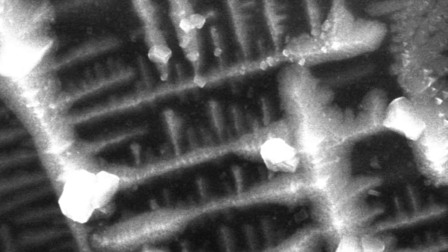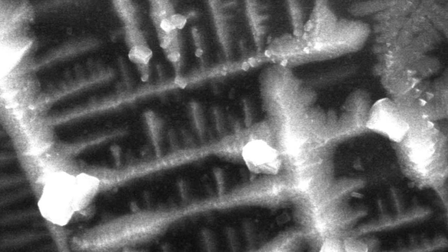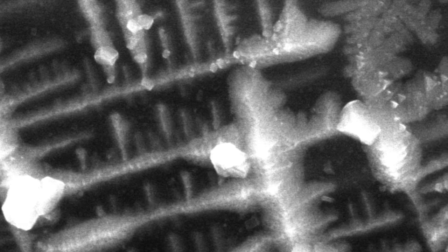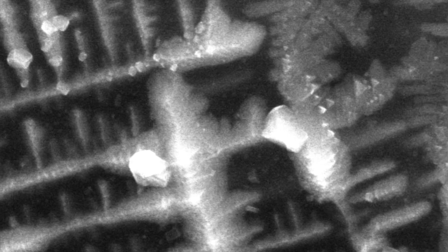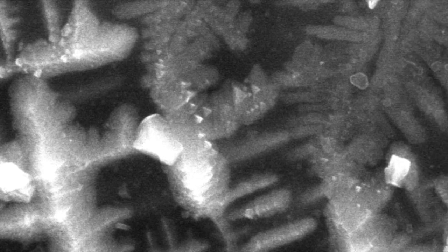And then on the right-hand side of the image, you start to transition from a solution of really rich iron into a solution that has a lot less iron and a lot more silica. So then the dynamic starts to change.